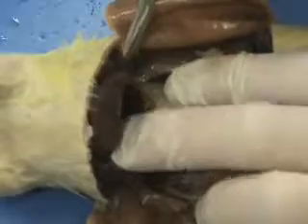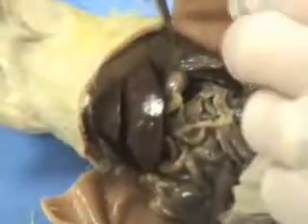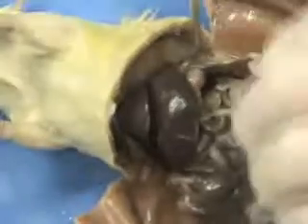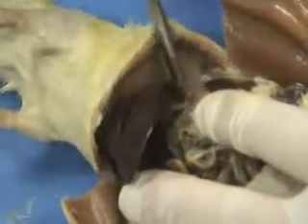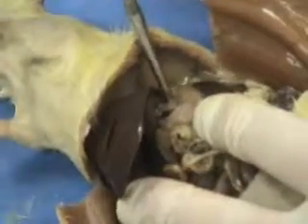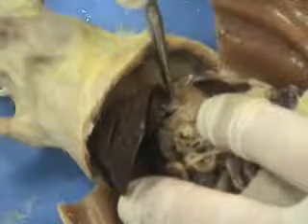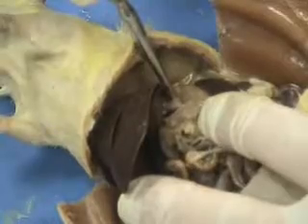So if I pull some of that tissue away, we've got the stomach right here in pink. So we could zoom in on that a little bit. And if I slice this back a little bit here, I might be able to open that a little bit more. So here we've got the stomach, and we've got a tube here on the anterior end of the stomach. This tube right here is called the esophagus. That esophagus connects with the stomach, and we've got a ring-like set of muscles that would be on the inside of that connection, and those are sphincters.